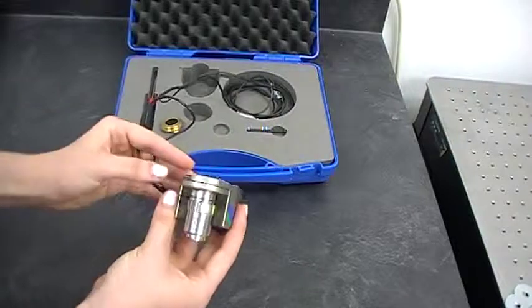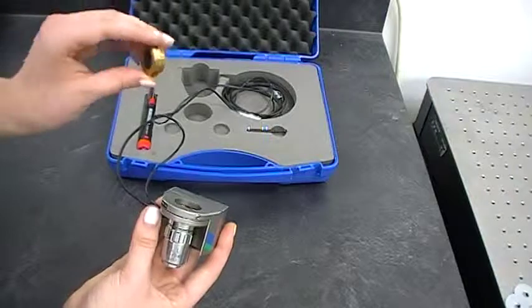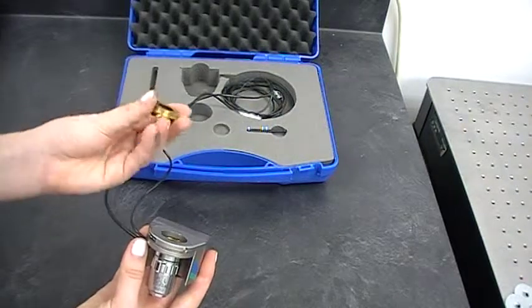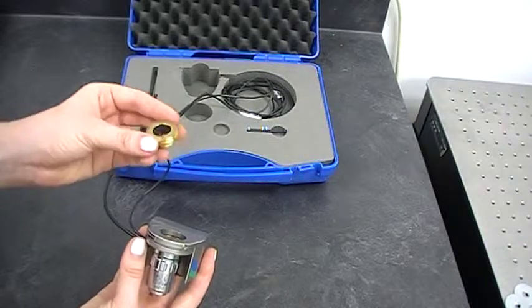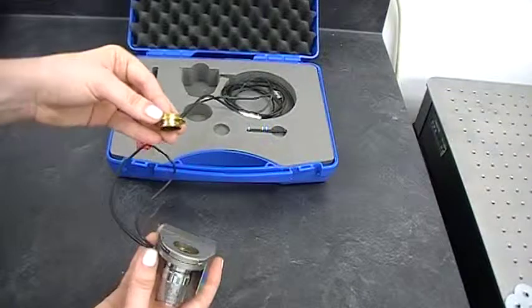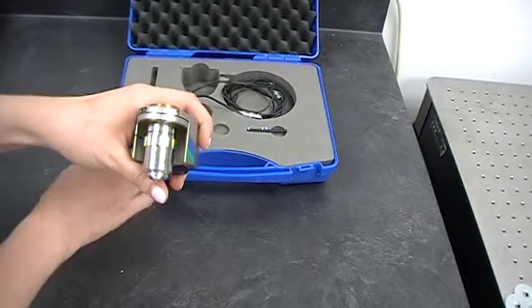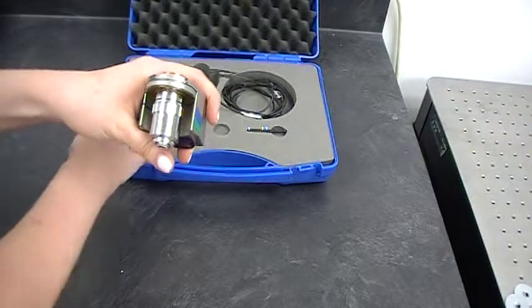Now you're ready to put it into your microscope. To do that, we have what we call the clamp ring. This part has threading on the top, which screws into where you would normally screw your objective lens. Once you've screwed that in and it's attached, you bring up this system — it pops onto here. Then we have a screw on the side, which comes in your kit here.